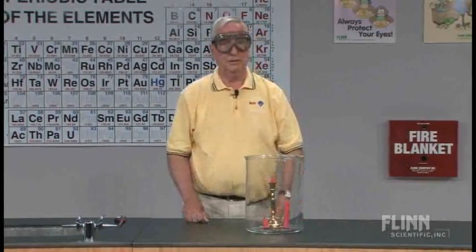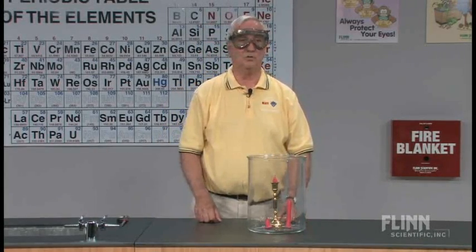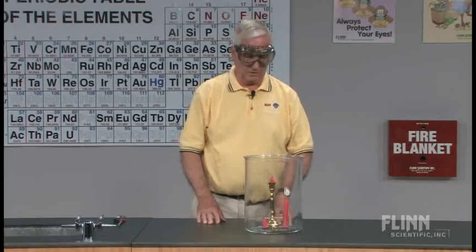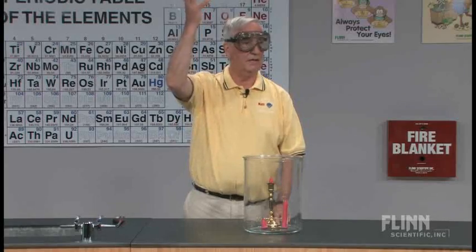So this is a neat, simple demonstration that doesn't take very long to do. It demonstrates a number of basic concepts in chemistry and in science in general, and is applicable to life experiences. One of the reasons why during a house fire you're always told to head to the floor and crawl out is because that hot carbon dioxide and vapors rise to the ceiling.